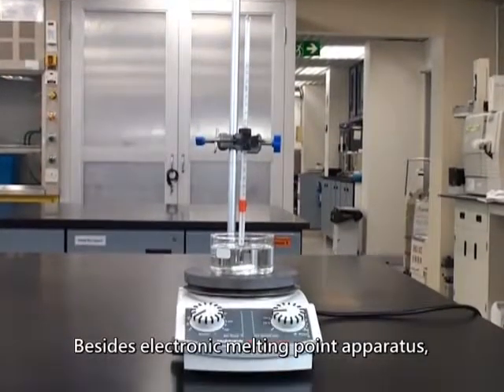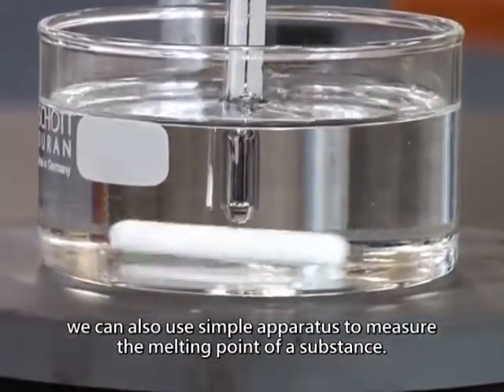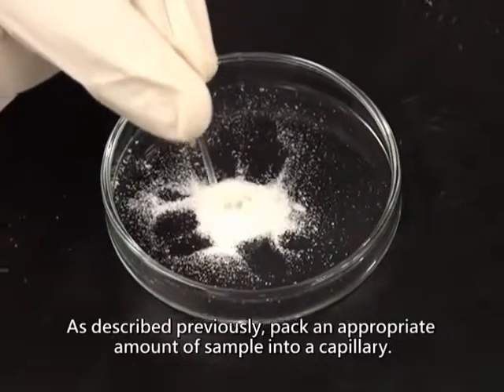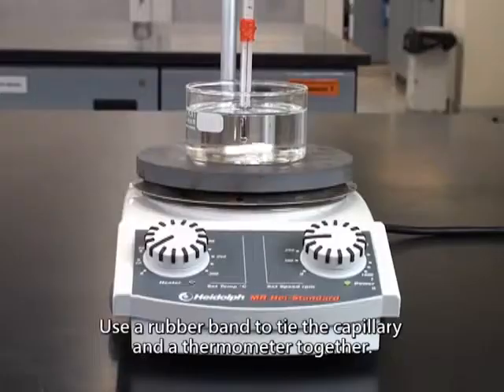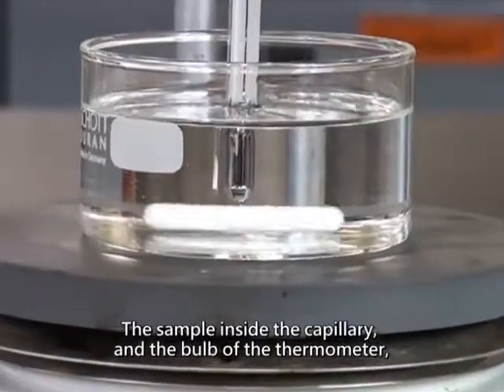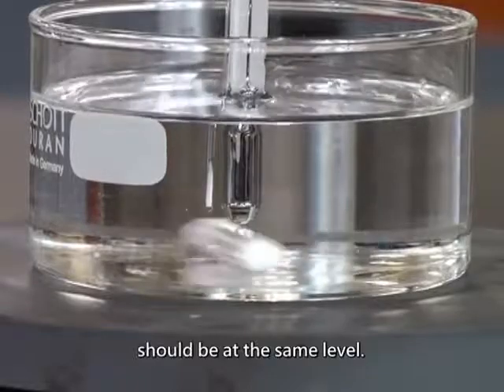Besides the electronic melting point apparatus, we can also use simple apparatus to measure the melting point of a substance. As described previously, pack an appropriate amount of sample into a capillary. Use a rubber band to tie the capillary and a thermometer together. The sample inside the capillary and the bulb of the thermometer should be at the same level.